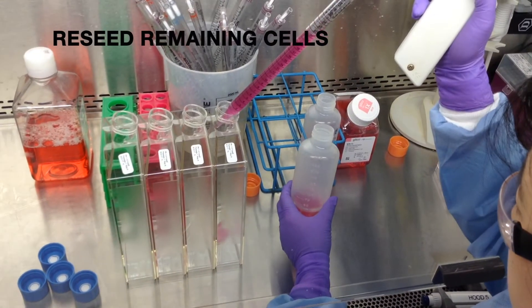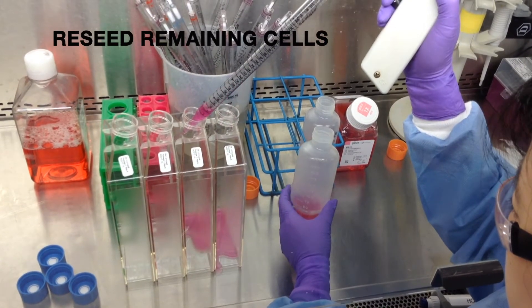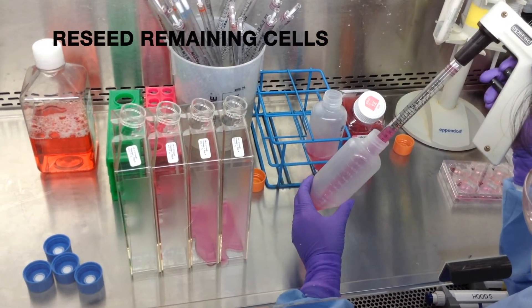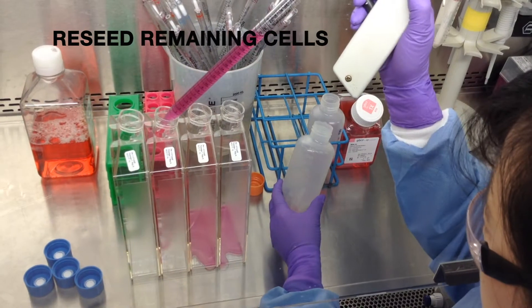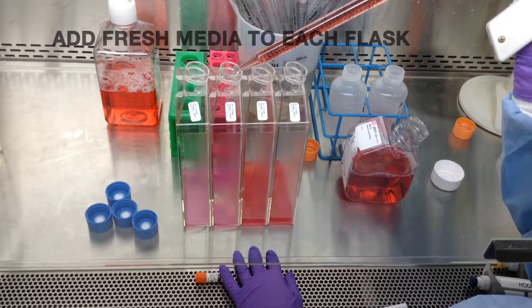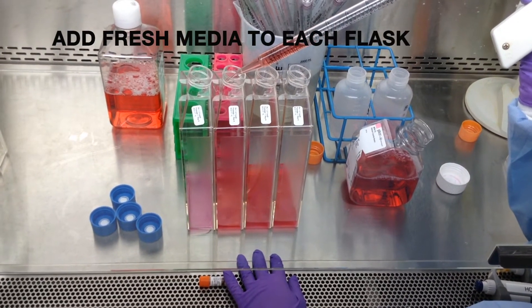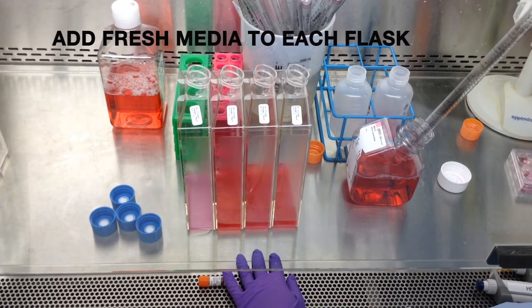Re-seed the remainder of the cells from the replicates into the appropriate number of flasks. Add fresh media to each flask, bringing them to their final volumes.